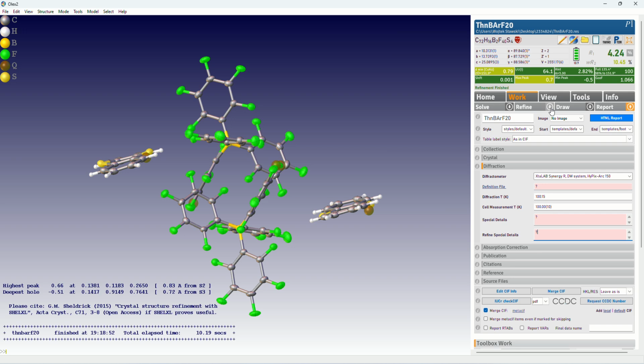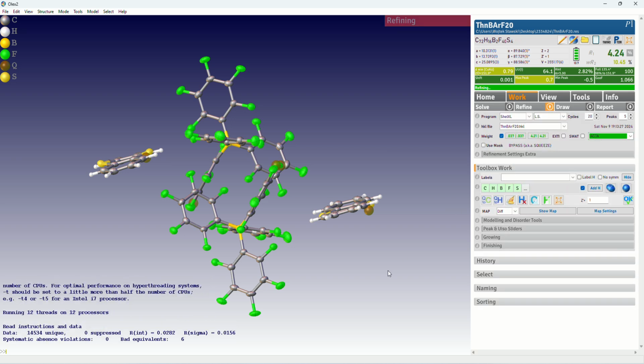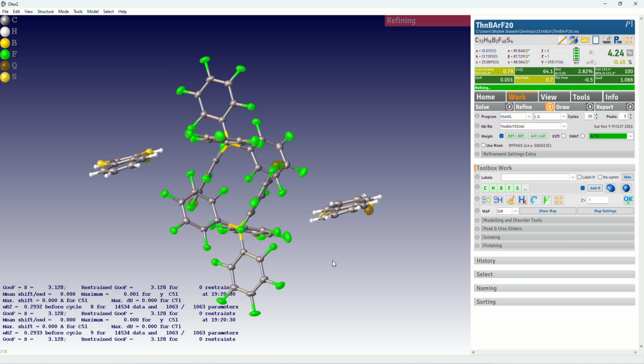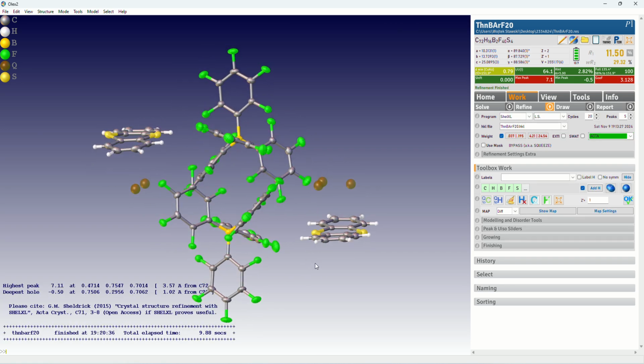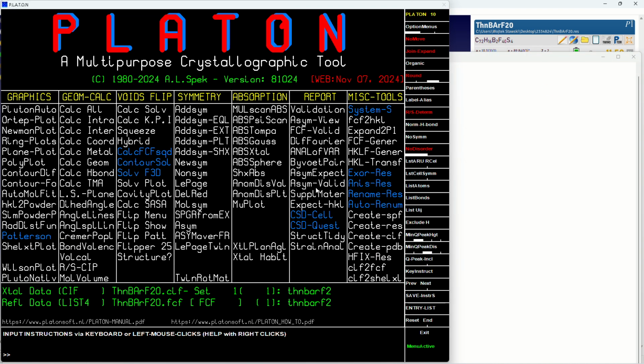So let's come back to the initial model. Let's not use mask. And now I will show you how to use PLATON. I'm not sure how it is pronounced in English. I think PLATON in English, and PLATON would be in Polish. Okay, so we need to have PLATON installed. So we click this PLATON icon. And now we have to click SQUEEZE.